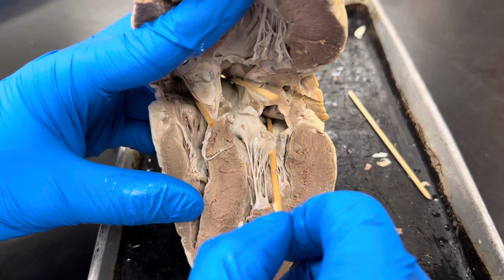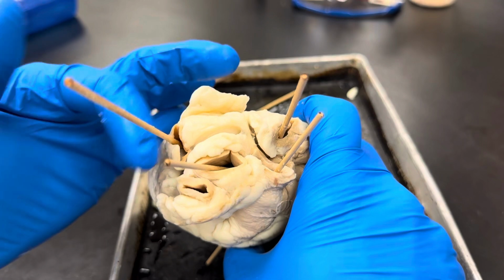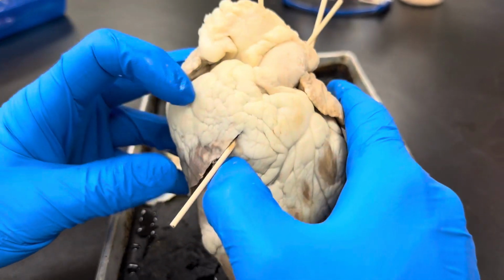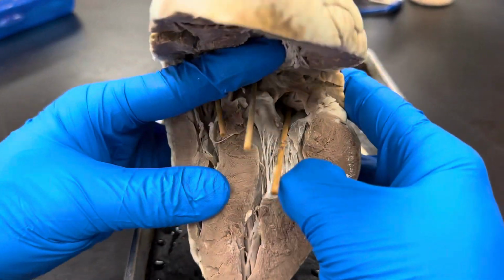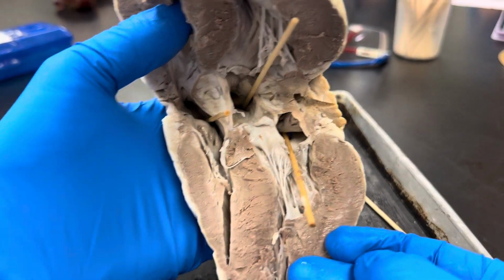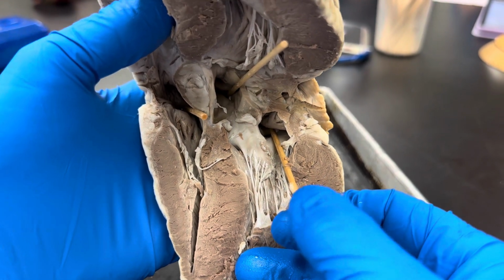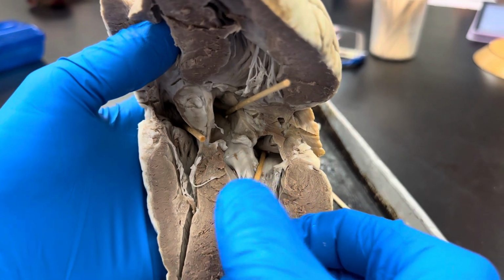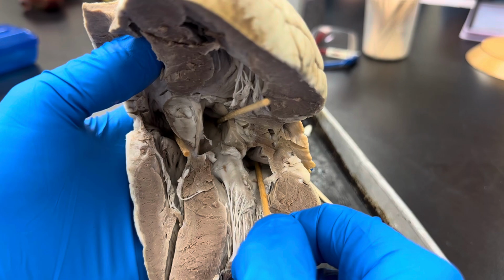The reason we have sticks in here is we're trying to take a look at the vessels on top, and it's kind of hard to know what these are. So what we did is we start putting sticks in here, and I know that wherever the stick comes out gives us an idea, well, actually the answer, of what vessel this is. So for example, when we're looking at this heart, we see that this stick is in the left atrium. The only reason it's sticking out farther is it passed through the mitral valve. So this vessel has to be the pulmonary vein.